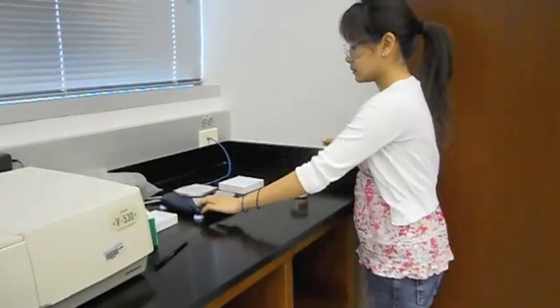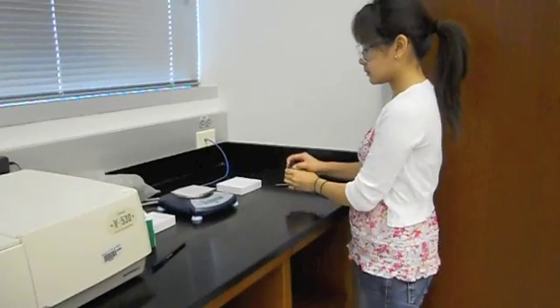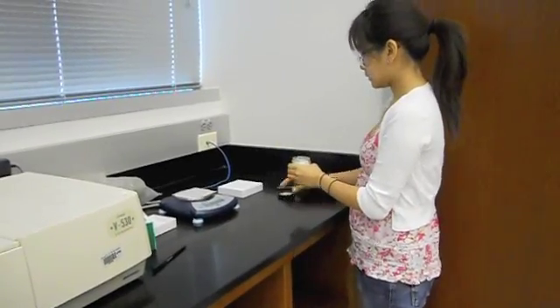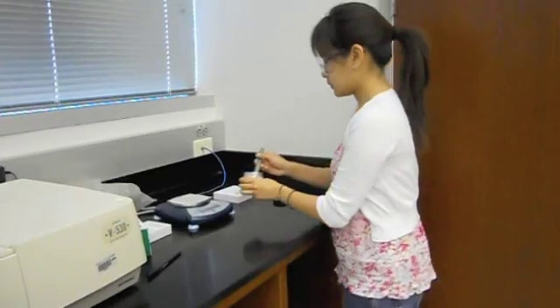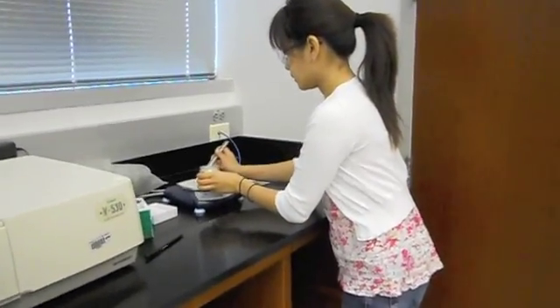When measuring out your mixture, make sure to tare the balance and record the mass to the nearest hundredth to ensure the correct number of significant figures when doing your calculations. You should also pre-weigh your beaker.